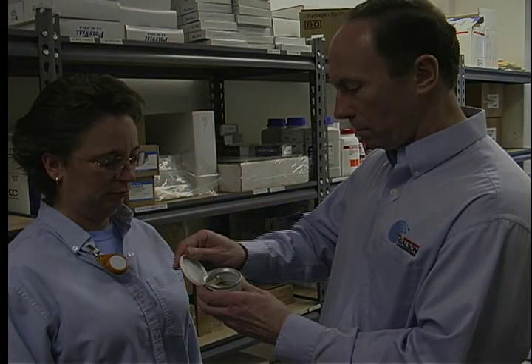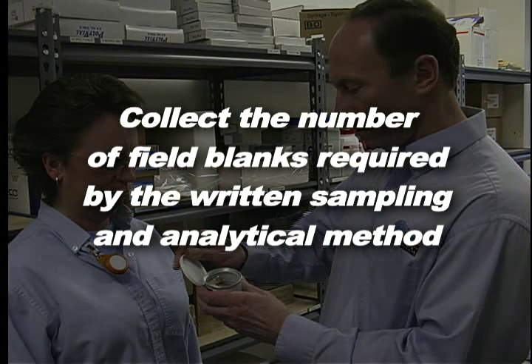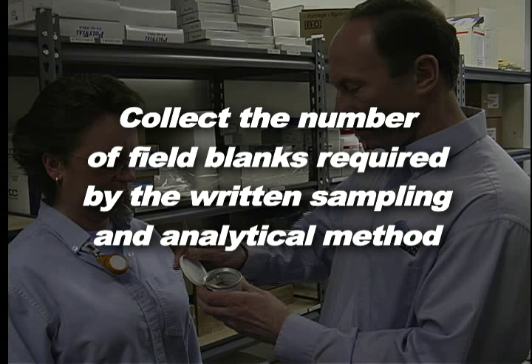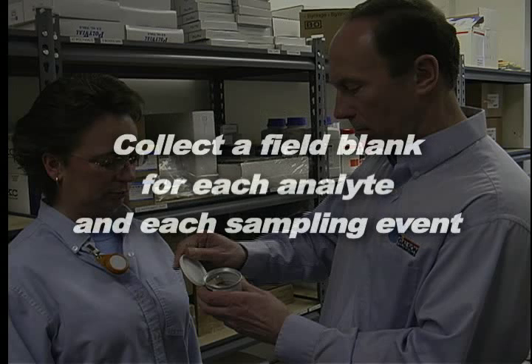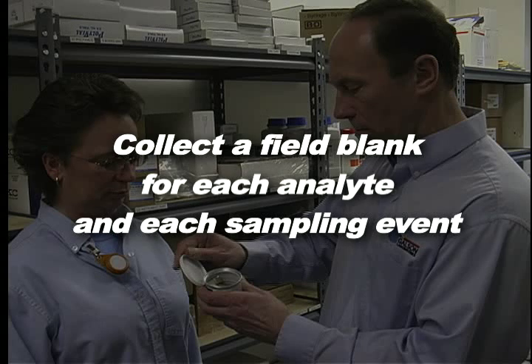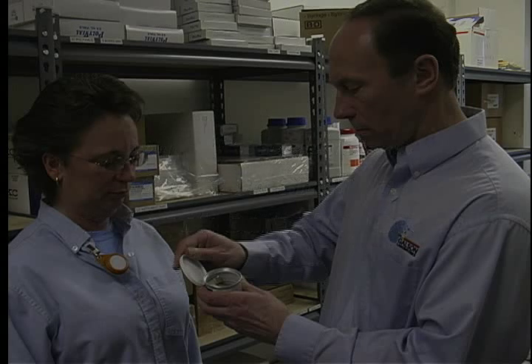At minimum, you should collect the number of field blanks required by the written sampling and analytical method. To generate defensible data, it is important to collect a field blank for each analyte and each sampling event.